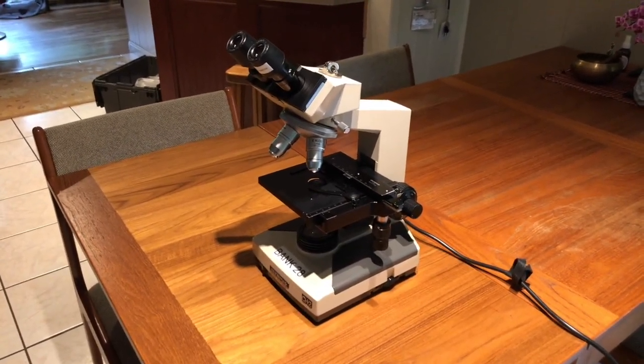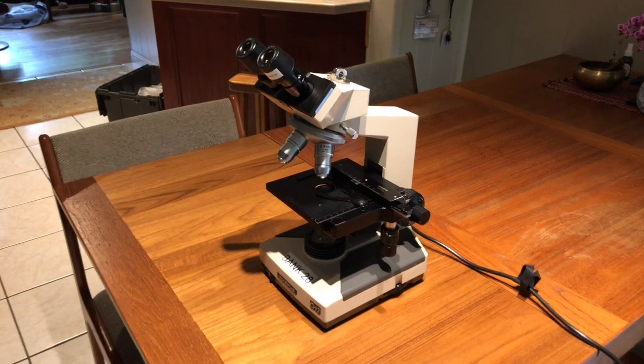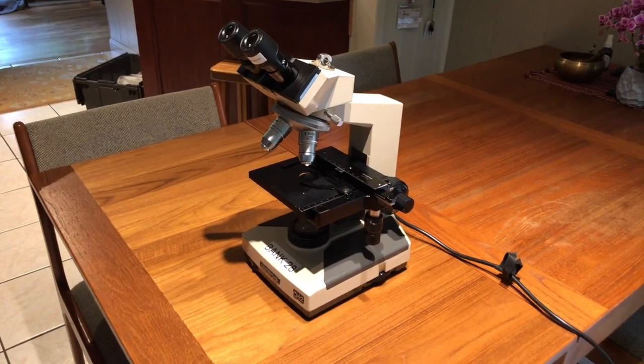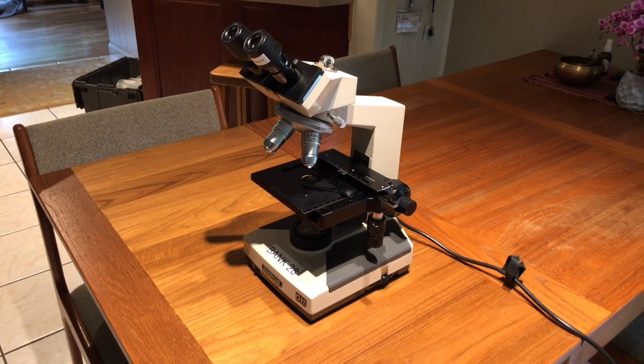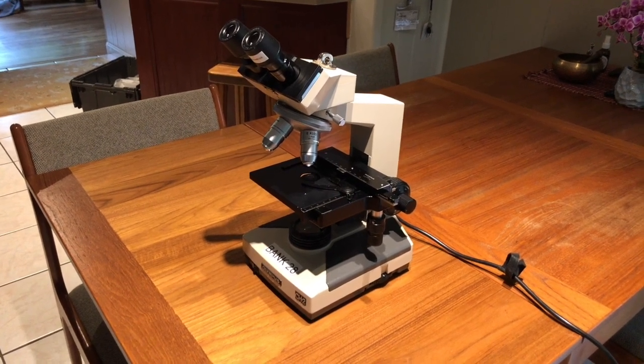Okay, this is just going to be hopefully a quick intro to help you get started using the microscopes.